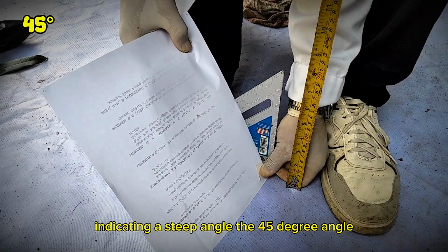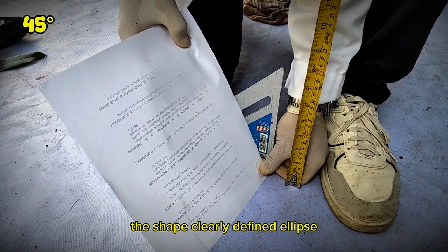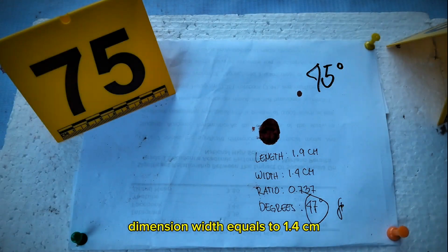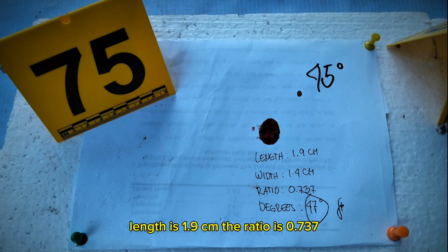The 45-degree angle. The shape: a clearly defined ellipse. Dimensions: width equals 1.4 cm, length is 1.9 cm. The ratio is 0.737. Calculated angle: approximately 47 degrees, consistent with the 45-degree target.